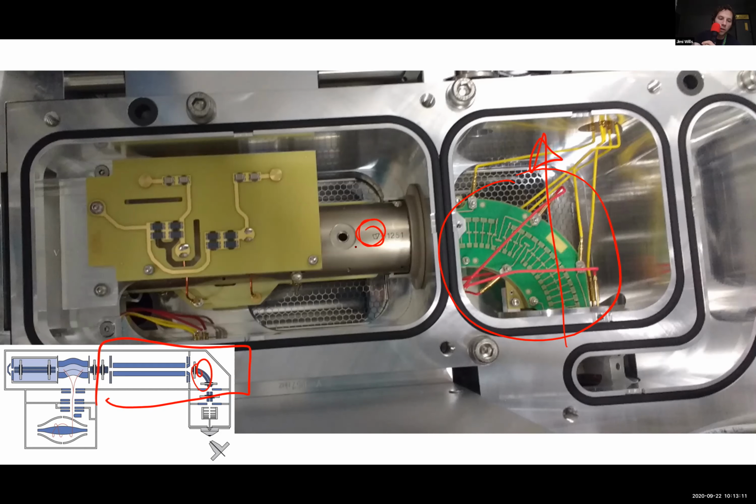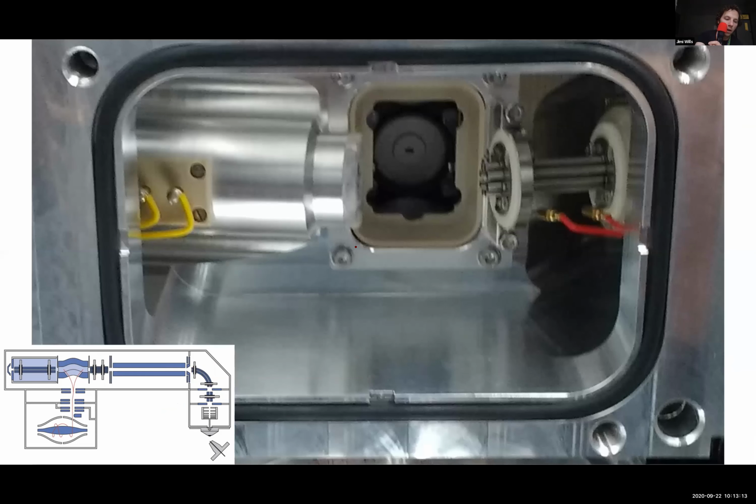And this is a view from the front again. So we're now looking, if you imagine on the schematic, there's a pivot point here. And all of this part on the left, in reality, is the other way around. So in fact, this is the front of the mass spec on this side. This is the front of the mass spec on that side. So what we're actually looking down this way. So kind of in that way.